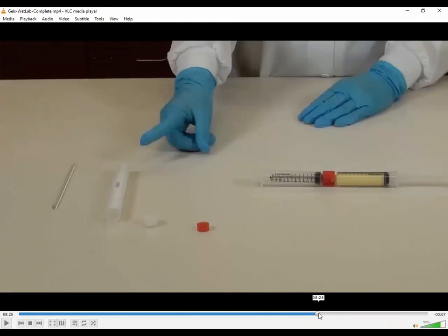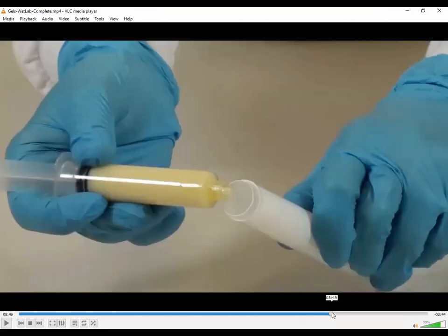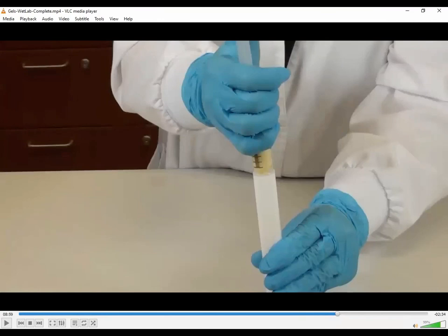The rest of this video has to do with then filling the AccuPen. So as we said, you're going to have all of the product in one of the syringes. You're going to then hold the AccuPen, and you want to hold it straight up and down, and you're then going to carefully squish all of your product into the bottom of that pen, okay? You're going to need to tap it, just like you did with the ointment jars. You're going to want to tap, tap, tap, tap, and carefully squirt and get as much of that into the very bottom. You don't want it dripping all the way down the sides on the inside. Get the gel at the very bottom of this long ointment jar, if you will, okay?